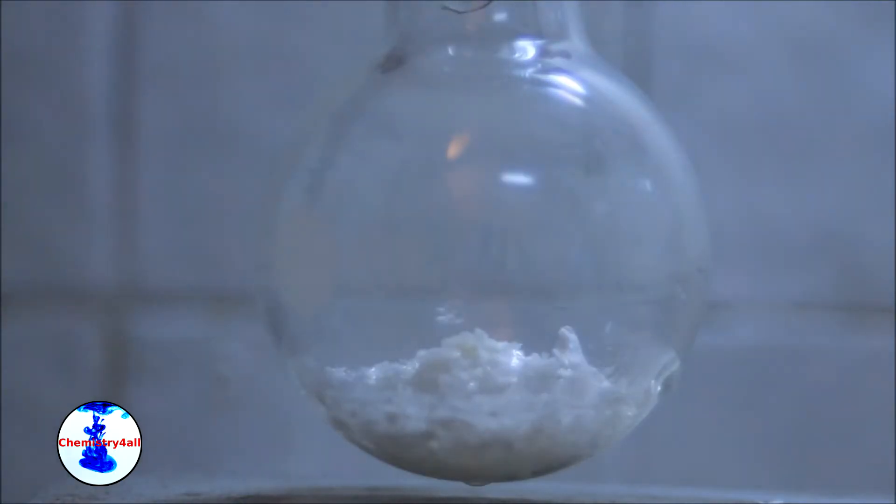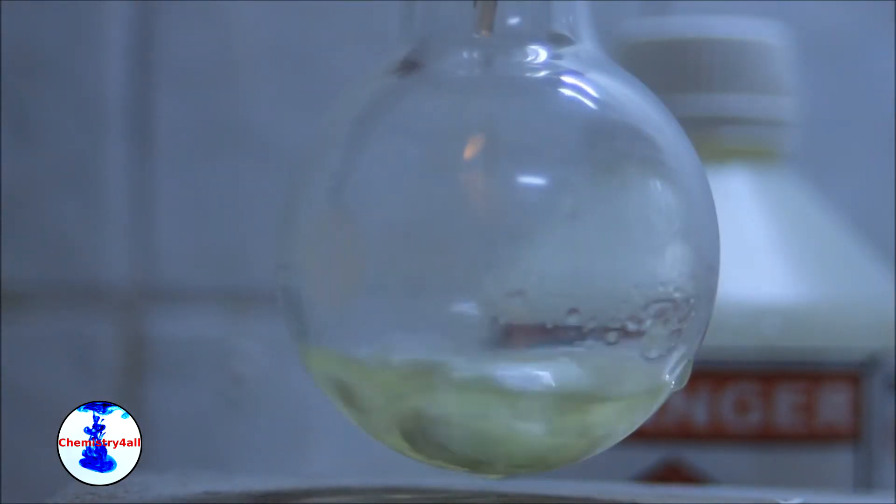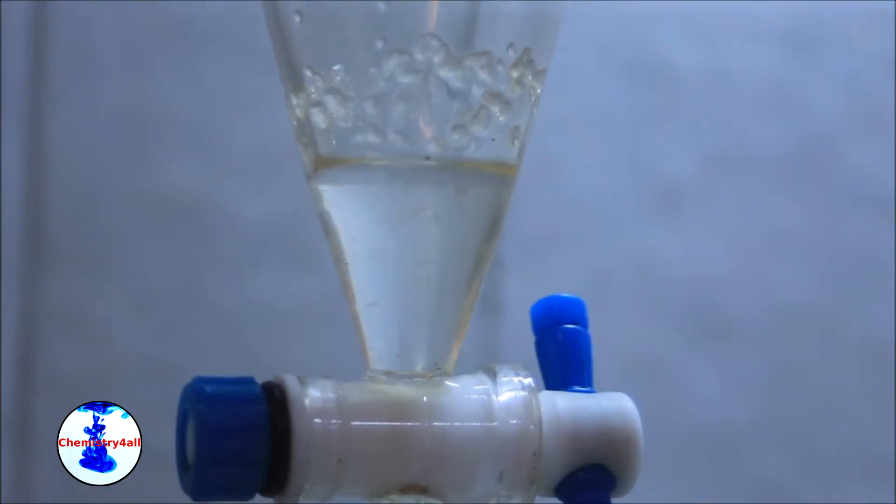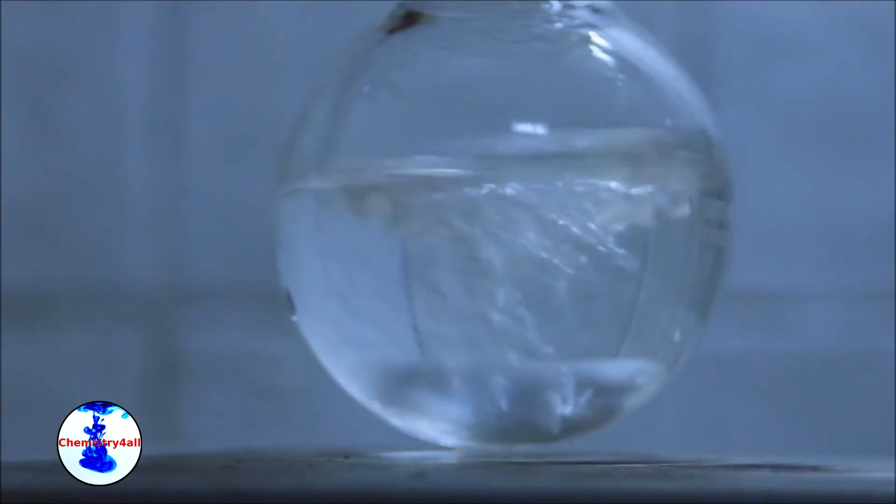Today, we will synthesize methyl benzoate starting from benzoic acid, which has been previously made from toluene. Like many other aromatic esters, methyl benzoate has a nice mint flowery odor and so it is widely employed in the perfume industry.